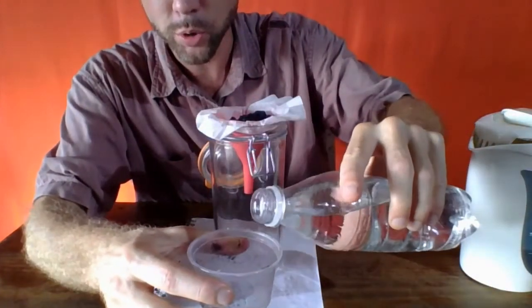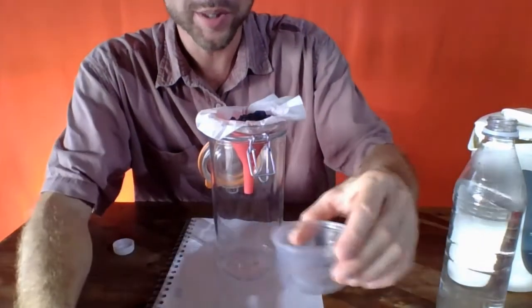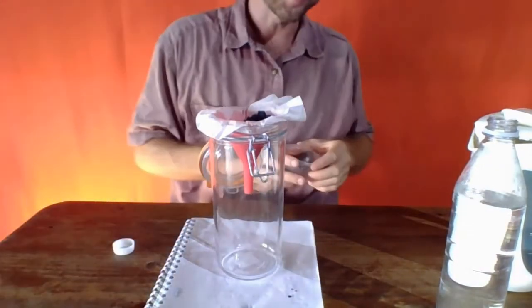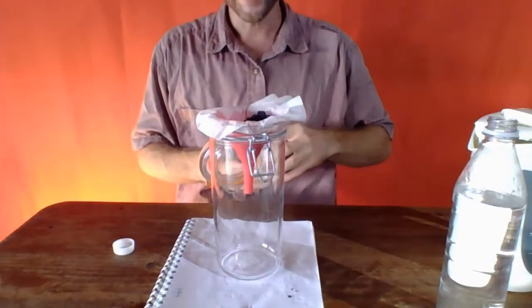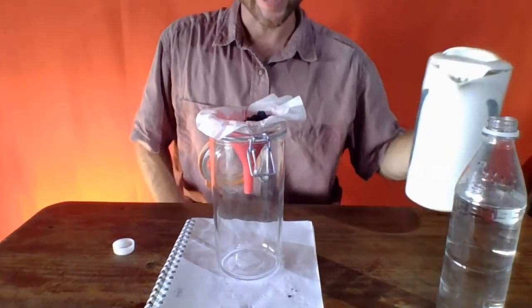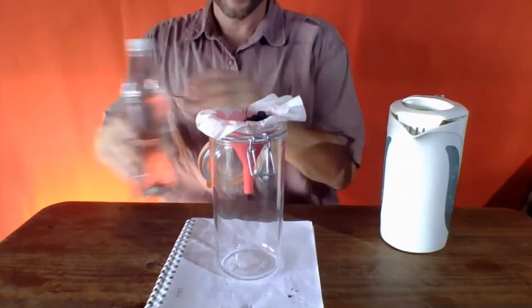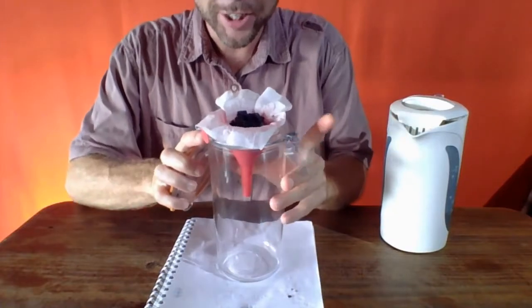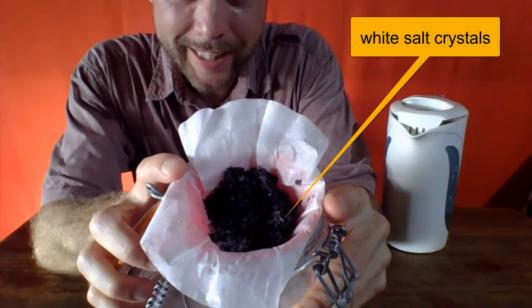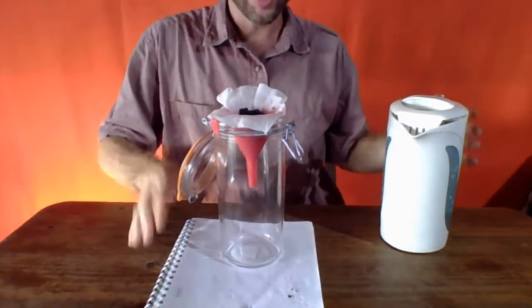I'm maybe going to use the cool water, not the hot water for this, right? We need to pour some water through this anyhow, so we might as well use the water that we're rinsing with in order to start the filtration. So I'm going to set that aside for now. Let's put the cap on this cool water, and we're going to get started with the hot water in just a second. But I'll tilt this down, and I think you can see there's a lot of black sand, but also a lot of white, maybe some of the larger salt crystals.